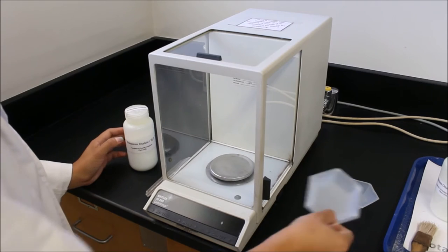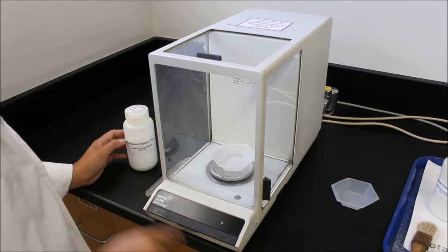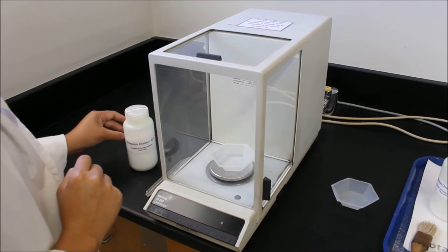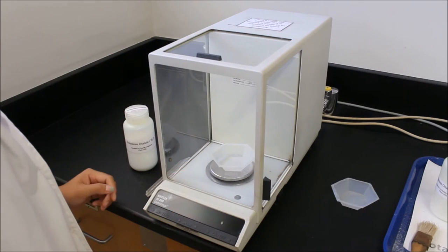So if you remember, you're going to put your weighing dish onto the balance and hit re-zero to tare the instrument. And when I mean tare, it means that you're taking into account the mass of the weighing dish and it should read all zeros. So after you do this, both of these open so you can stick your hand in there.